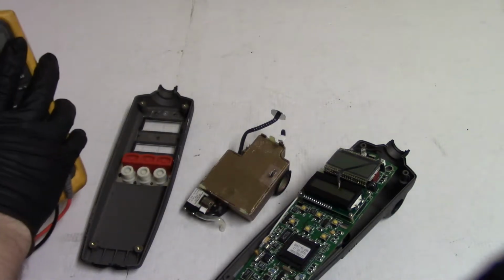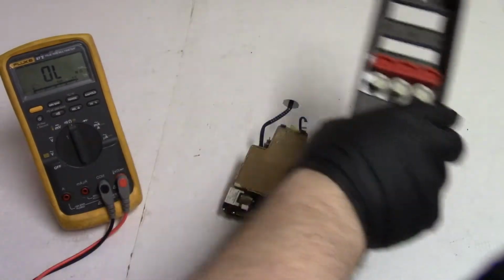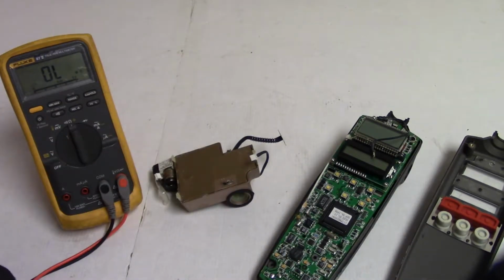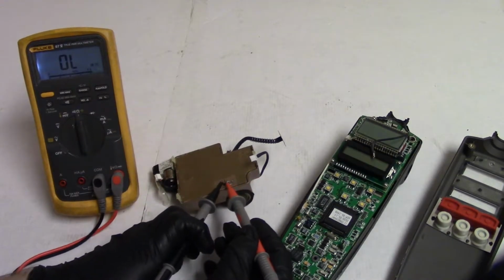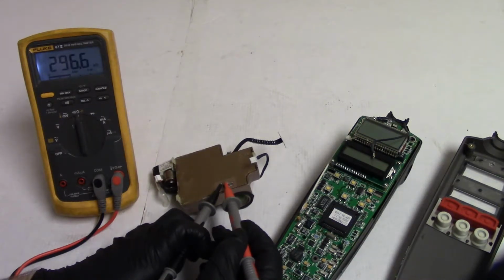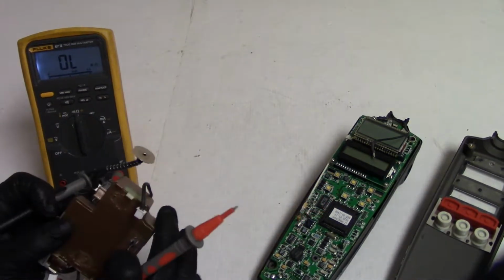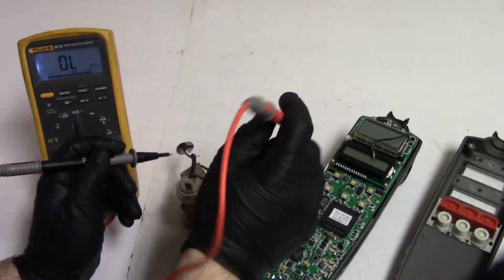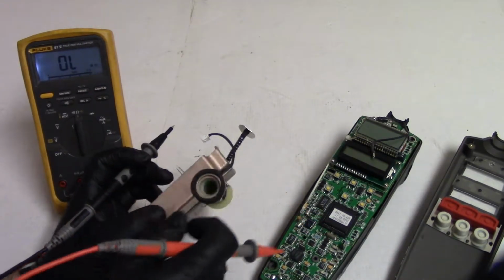So I got the meter. Let's see how many ohms, if any, that transformer is. You guys can see that? Yep. So let's go across. 296.6K. That could be right. Let me just make sure that these are definitely not connected. Yeah, they're not. So I think that those pads in here probably are the other side of this.